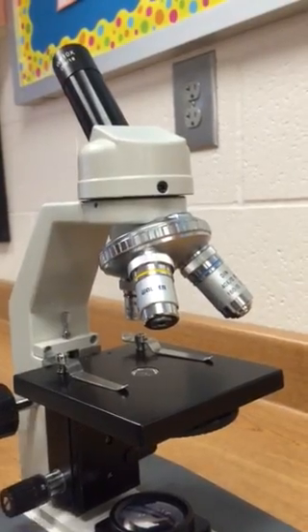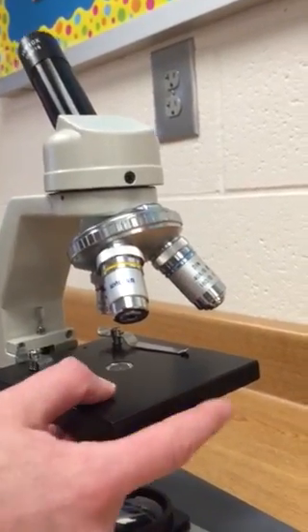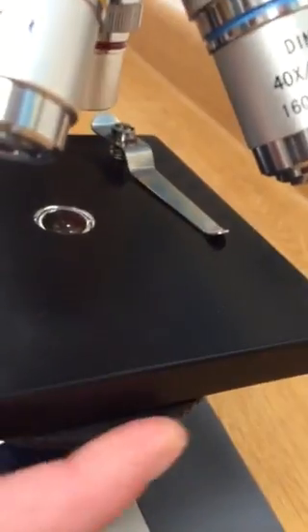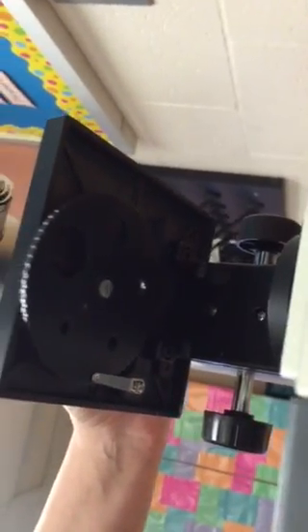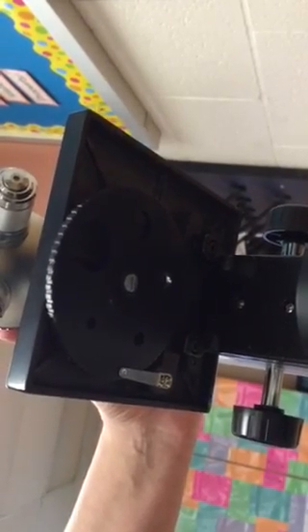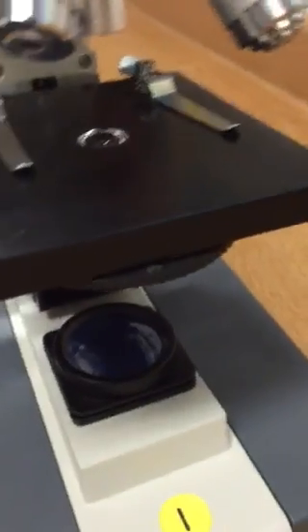Right here we have this knob that has numbers on it, one through five. This is called a diaphragm. What a diaphragm does is allow a certain amount of light to come through. You can see the little circles underneath showing how much light is able to pass through. If I have a smaller circle, I won't have a lot of light, but a bigger circle lets a lot of light come through. I can change that depending on my specimen.